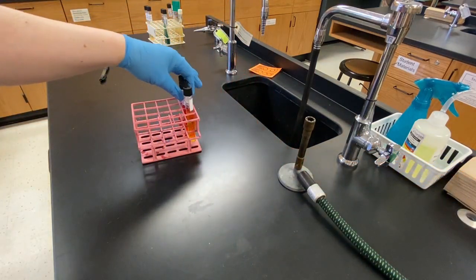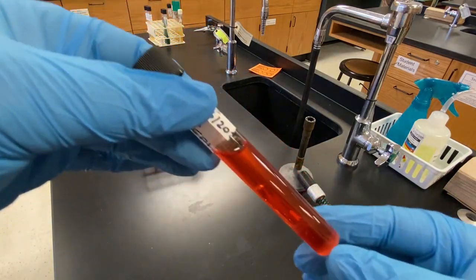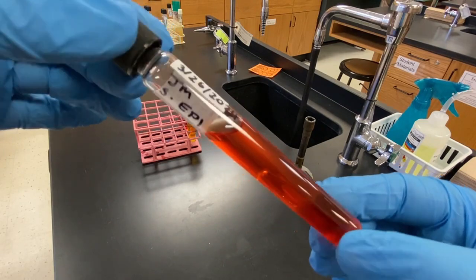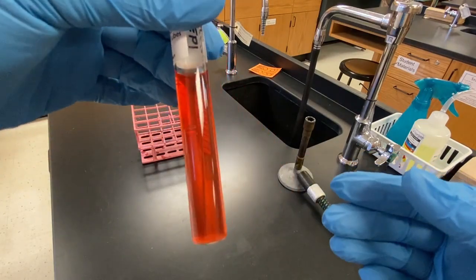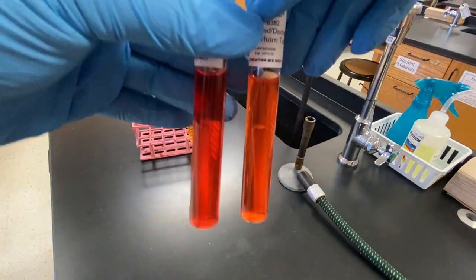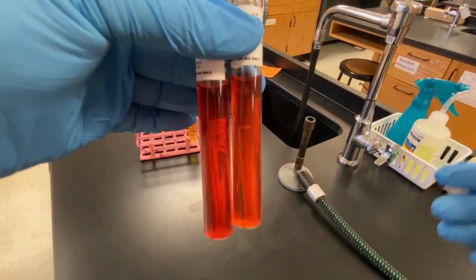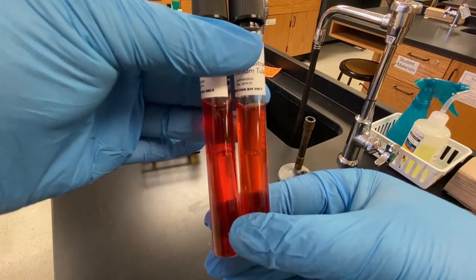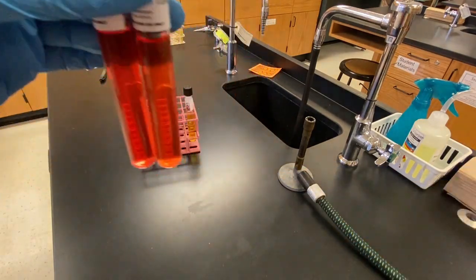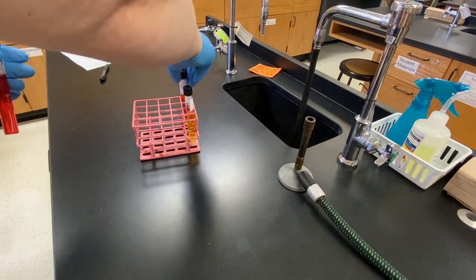The second tube is Staphylococcus epidermidis, also in the dextrose phenol red broth. This microbe is expected to be positive for this test, meaning that the microbe can ferment glucose and produce acid. The expected colour change is red to yellow. However, as you can see here, the broth is orange. It could be the case that the broth was not incubated for long enough. Typically, orange is an inconclusive result and would need to be repeated.